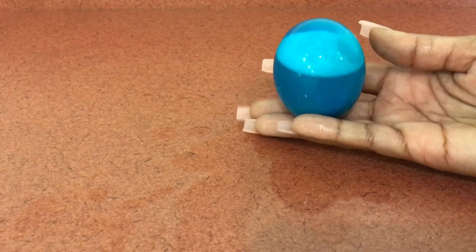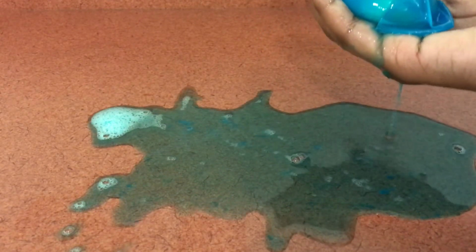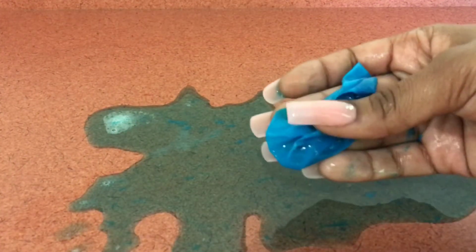because it eventually will pop. So after I realized it was so thin that it had popped, I decided to still show off the yolk and the skin around the yolk. I had to rinse off the blue egg just because I had lots of product on my hands.